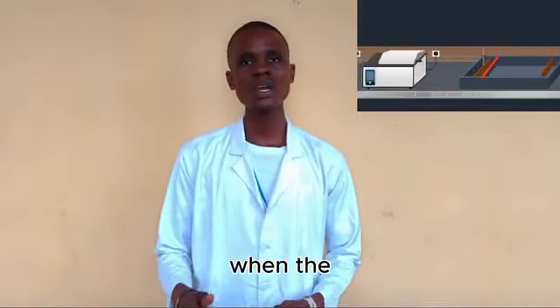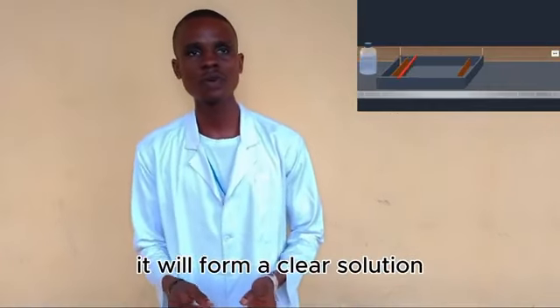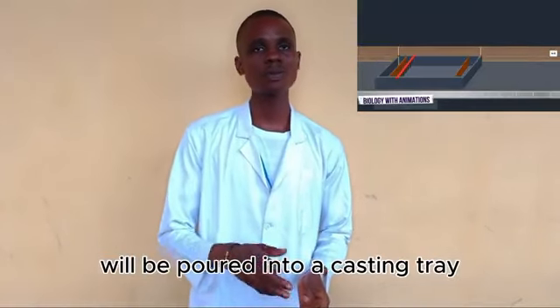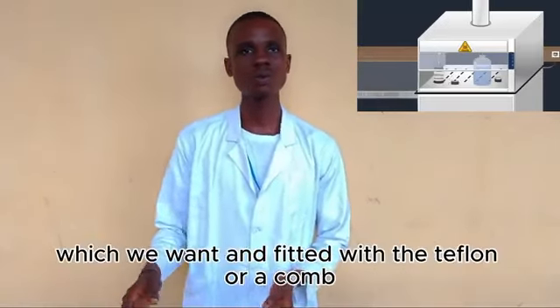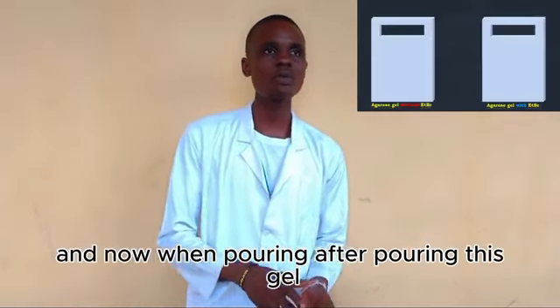Now, when the solution is heated to a point below boiling point, it will form a clear solution. This solution, on cooling, will be poured into a casting tray fitted with a Teflon comb.